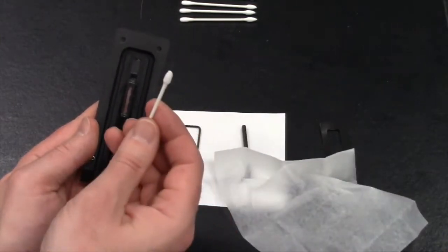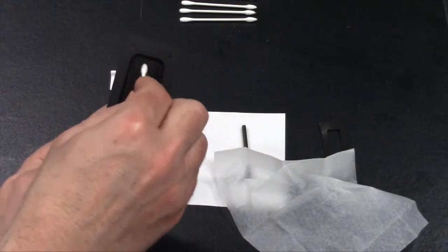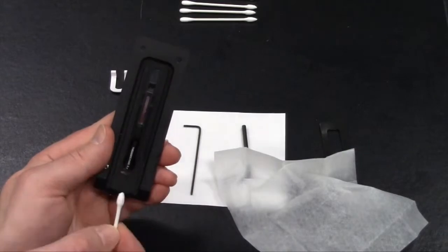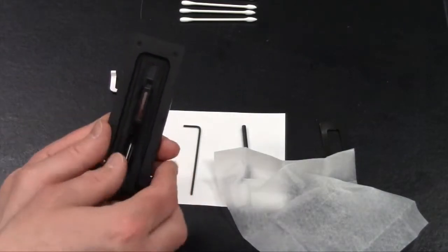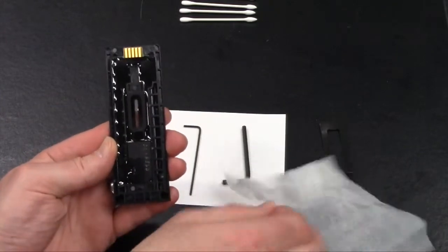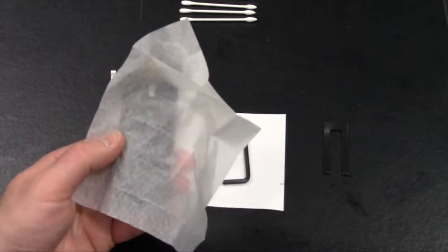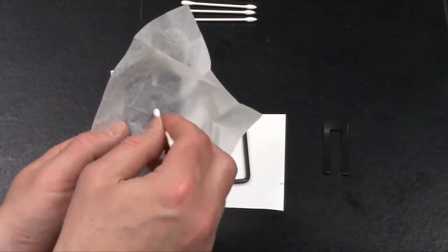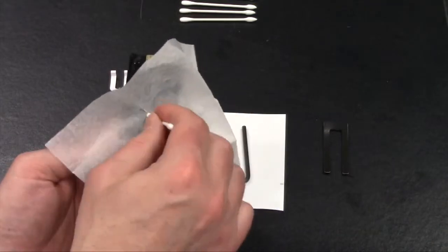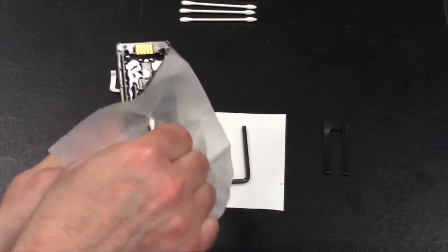Once the swab is wet, you can also use this to clean the different areas, making sure you pay attention to the very top and the very bottom areas of the lens. What's also important is to make sure that you turn the lens over and clean the back part of this lens. This will be a little bit trickier, so you can use the wipe to also clean this area extremely well, using the pointed tip to clean that lens area as best you can.